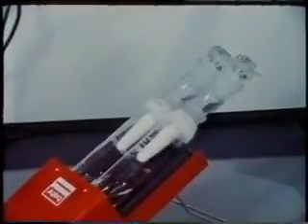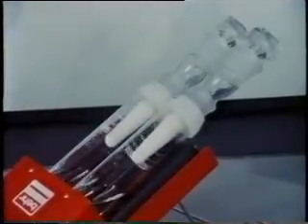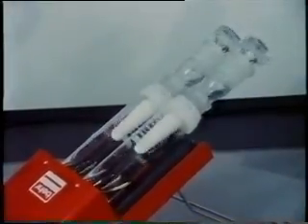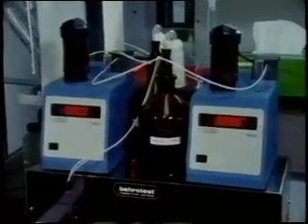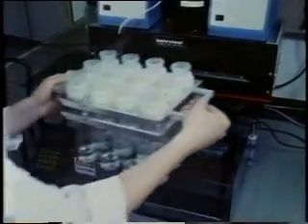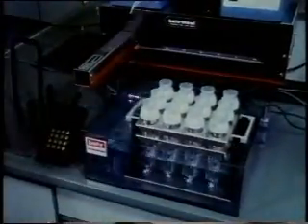If the analysis samples have a chloride ion content of greater than 1 gram per litre, this must be dissipated by means of an HCl absorber. A rotation device can be used to speed up this procedure. The reaction vessels with the prepared samples are now placed in a cooling bath.